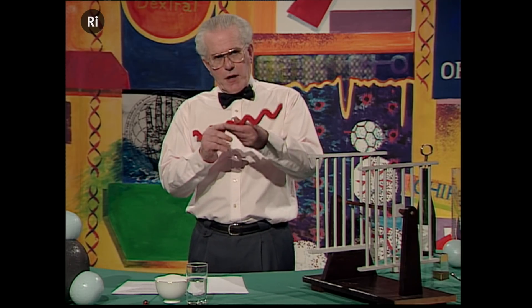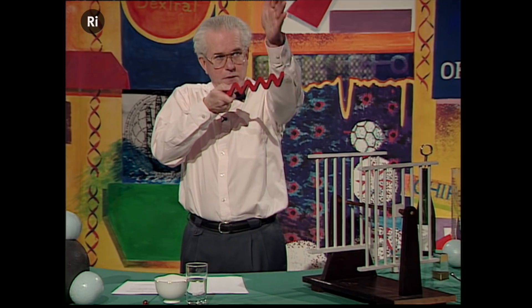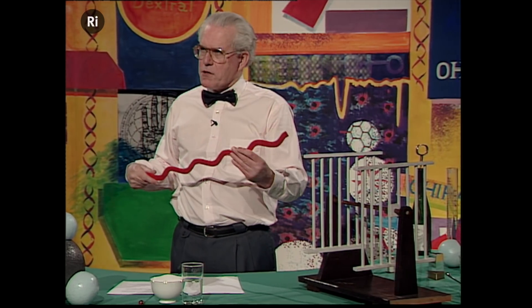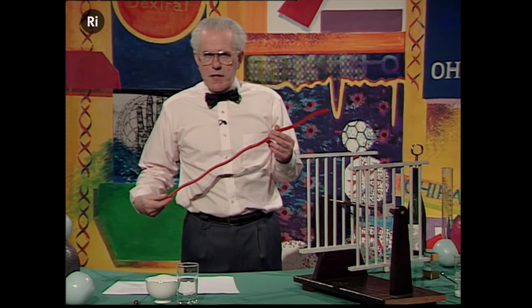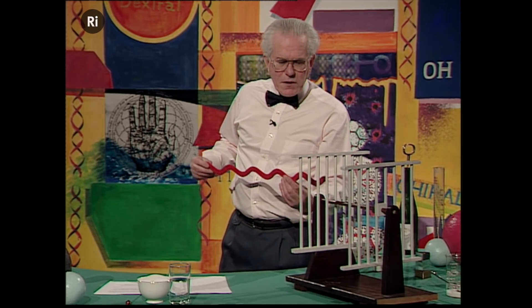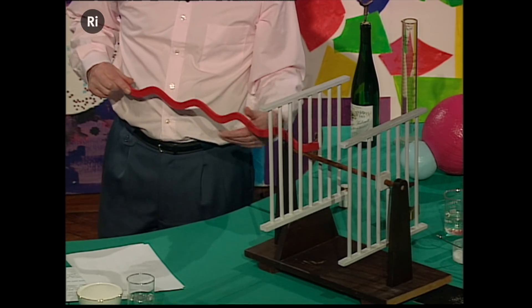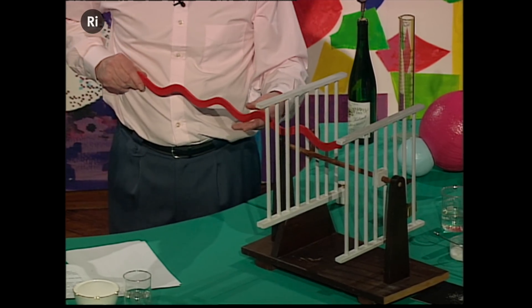But for the purposes of the experiment that we're going to do for you now, we want light which will wriggle only in one direction — that direction, that plane. And that is what we call plane-polarised light. Now we can make plane-polarised light in the following way: we take a chaotic ray of light and we put it through a special prism — we can call that a gate.